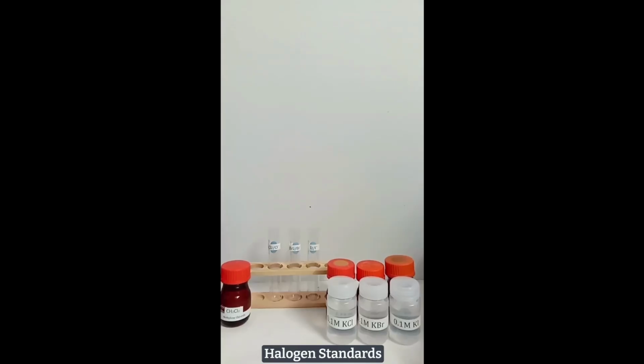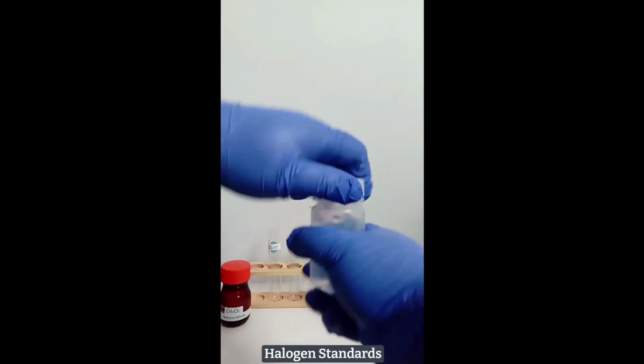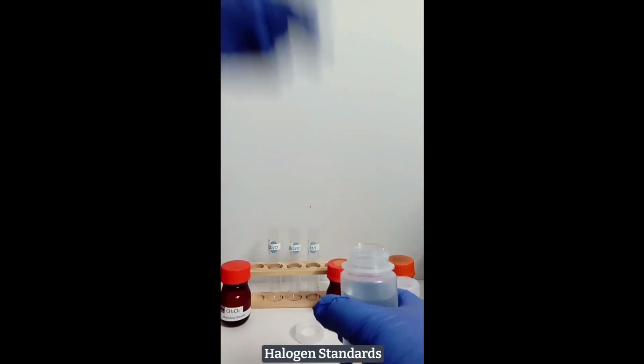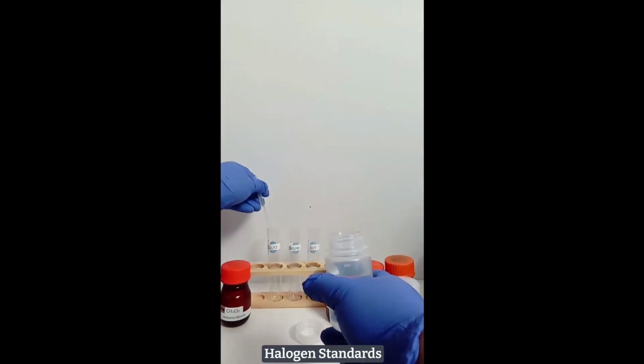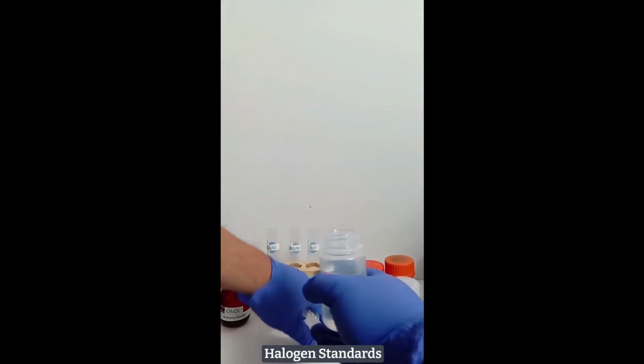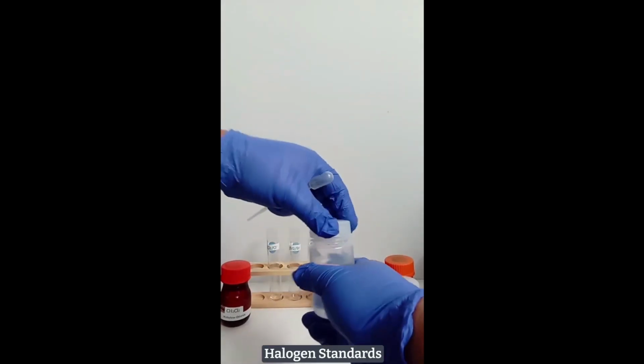Here is the demonstration in preparing the control samples for the halogen and halide mixtures. The first test tube gets 2 milliliters of 0.1 molar potassium chloride solution.